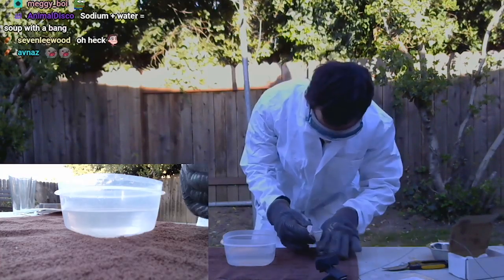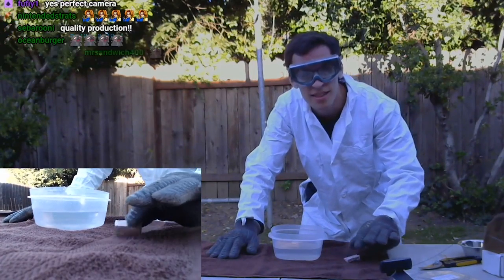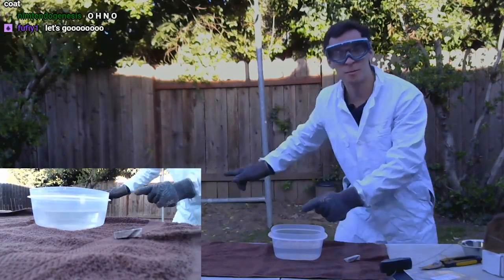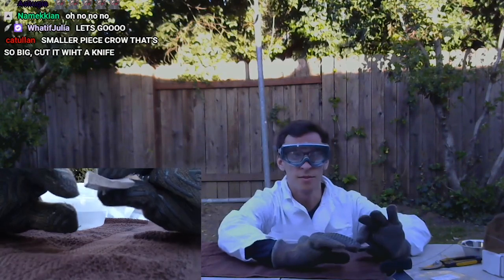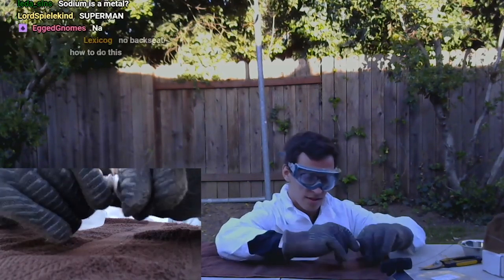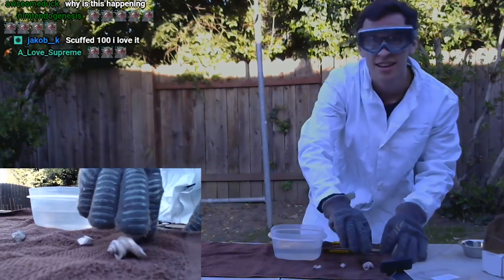Let's go back to sodium. There's a little chunk right there. We're going to put the rest back in. This right here is pure metal sodium, and here is water. Sodium reacts extremely violently with water. I haven't done this myself yet — once I plop it in, I'll probably be running. Let's do a smaller amount. Fun fact: sodium is extremely light, so you can bend it. Look, I'm so strong I can bend metal! Let's start with that small flake that dropped off. You guys can't hear this, but it's sizzling.